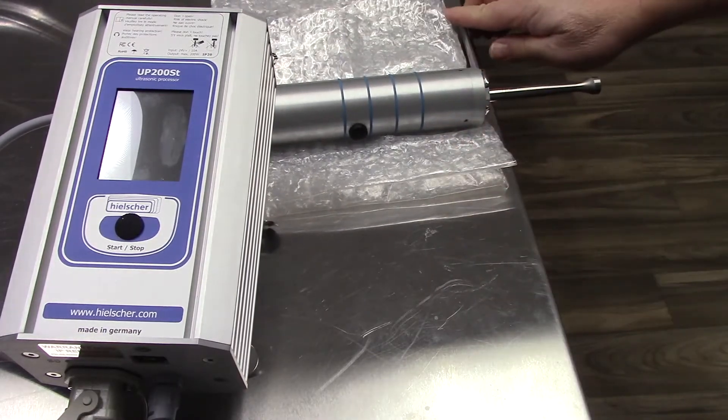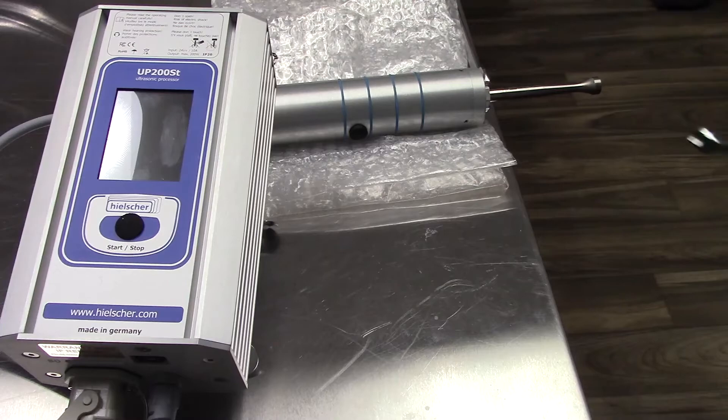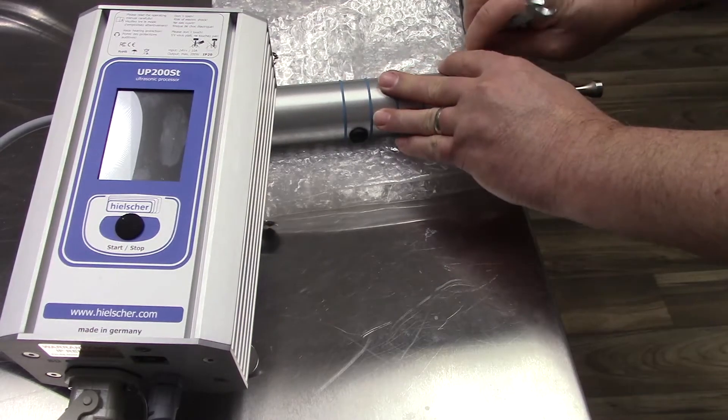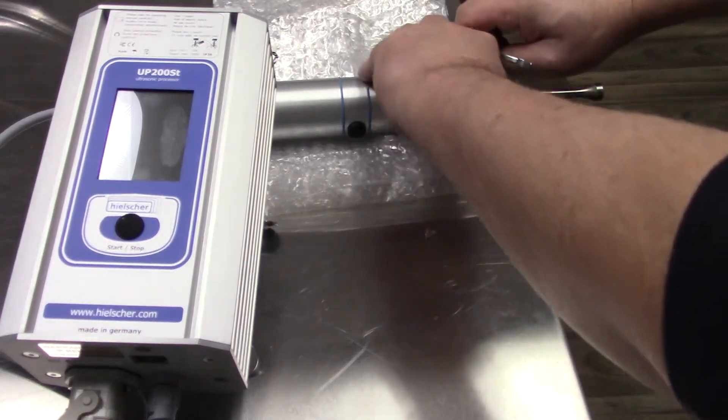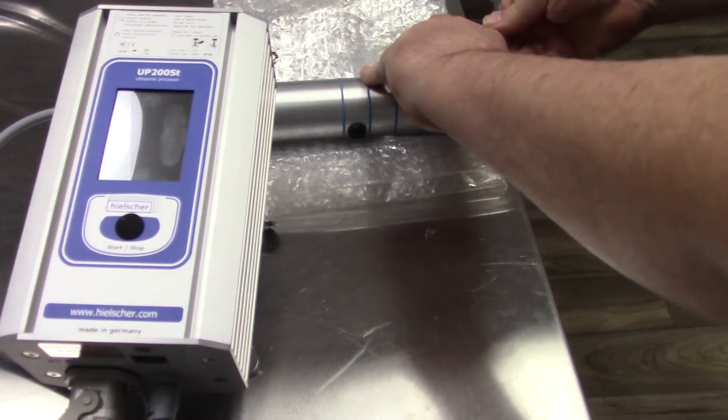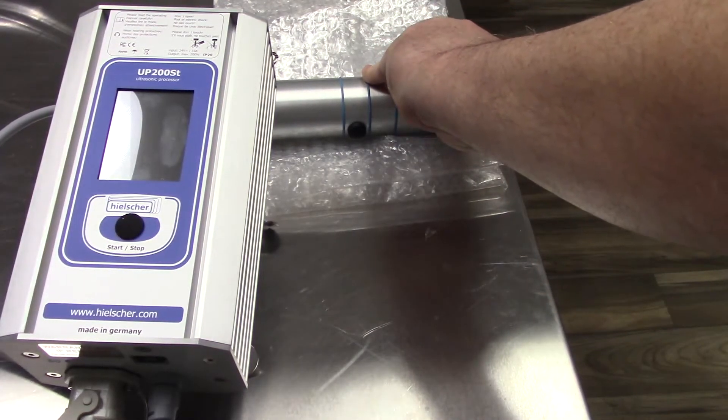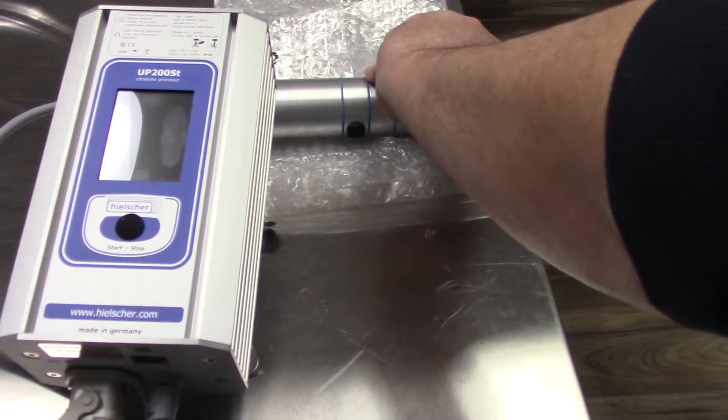Once again, using the table, turn down and tighten.